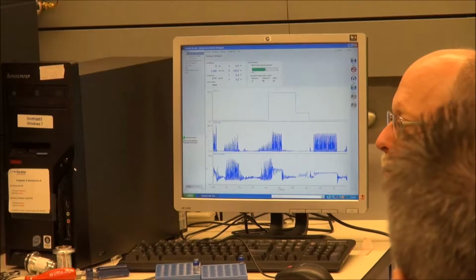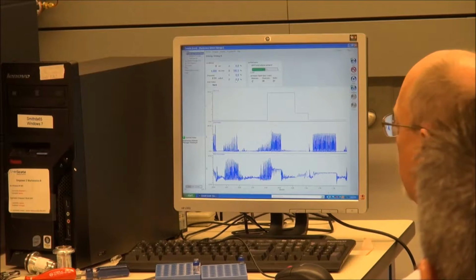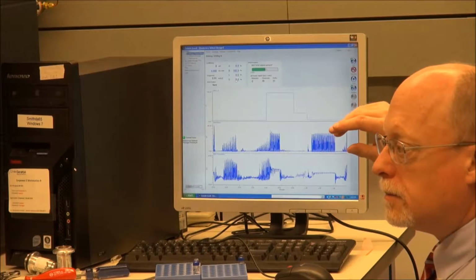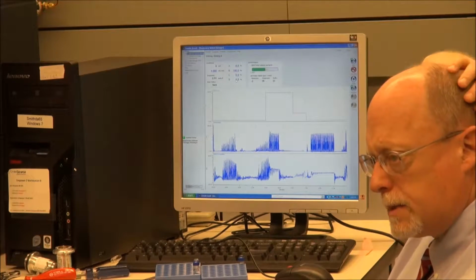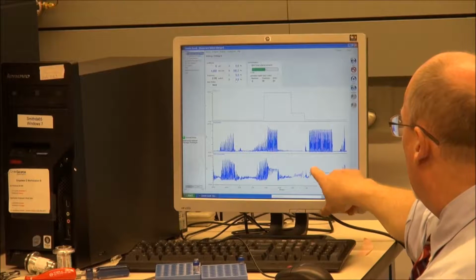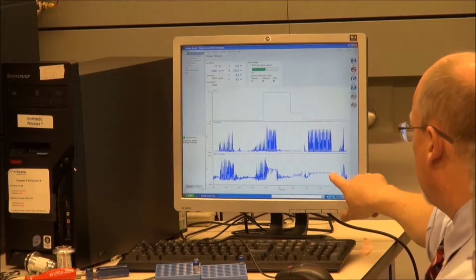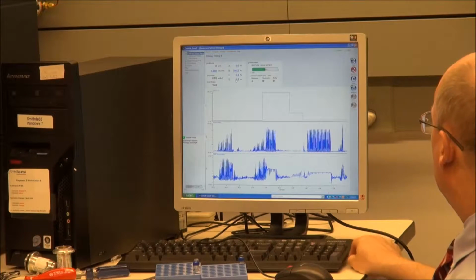So yeah, we want about 4 to 5 minutes per line when they're dry. Like the Alliance, which I think can go up to 8 mils a minute, where this is going to 4. When you have lots of high organic, this is the kind of cleanup that you see very fast, and this should clean up. Whoa.